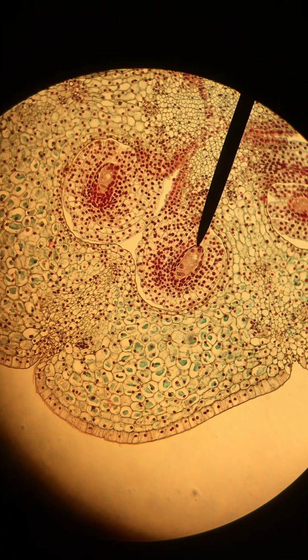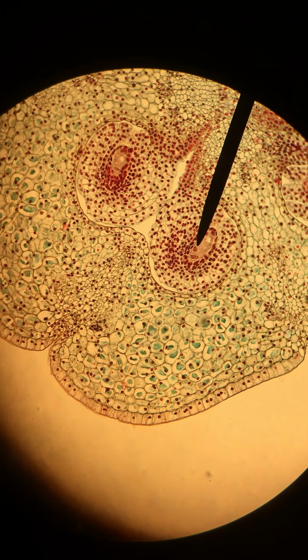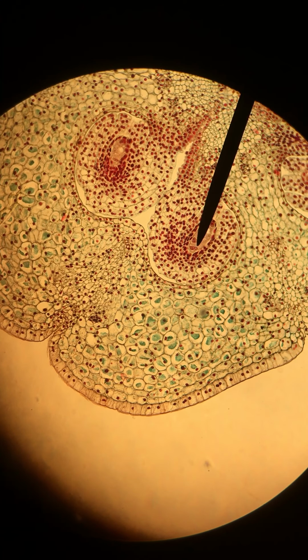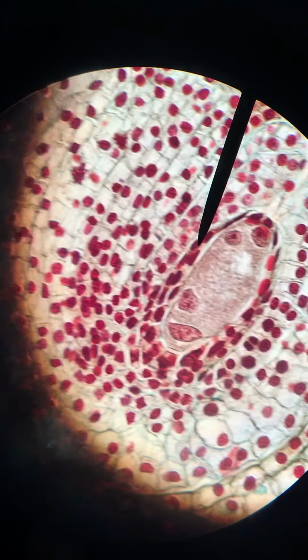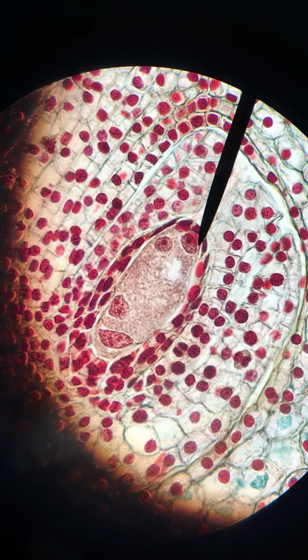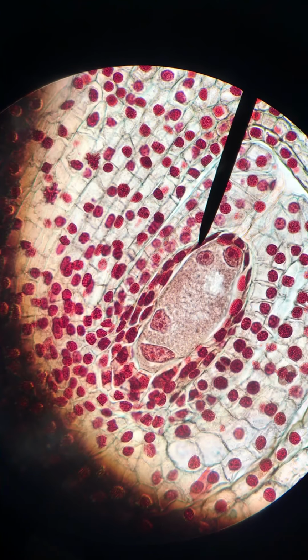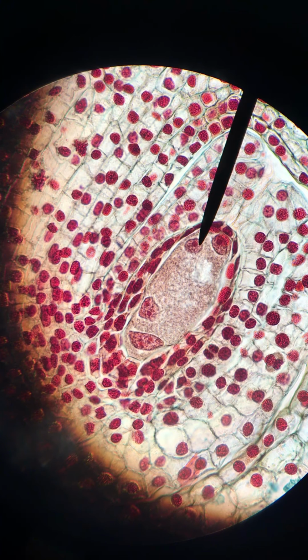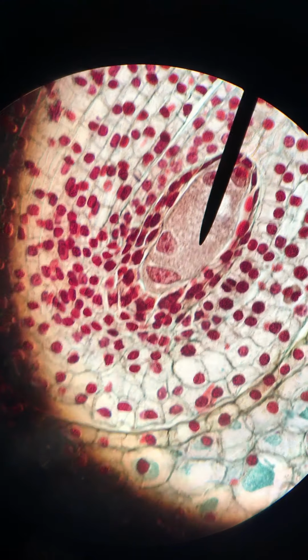So at this point, what you can actually see, we will zoom in once more, but you can see that there are 4, 1, 2, 3, and 4 structures within this ovule. So we will increase our magnification once more to about 400 times so we can see that a little bit clearer. So again, here is what had been our megaspore. It has undergone its first 2 mitotic events, producing 1, 2, 3, and 4 nuclei in this one space here.